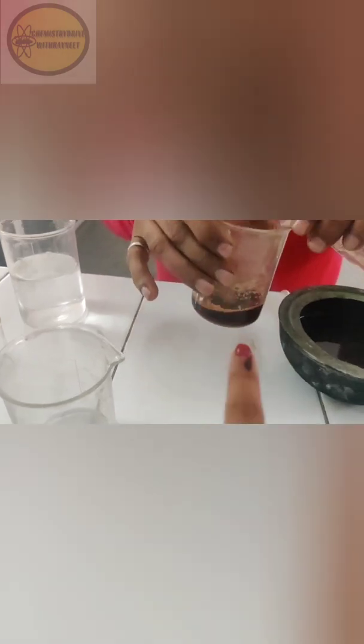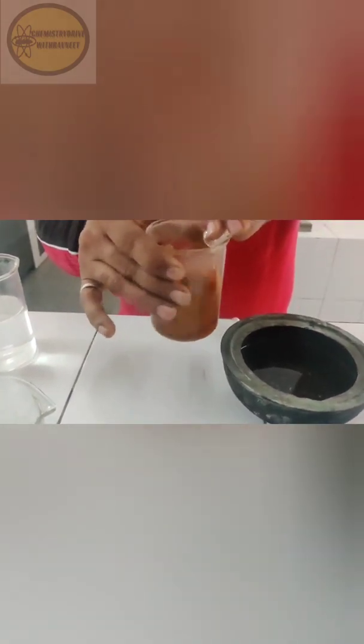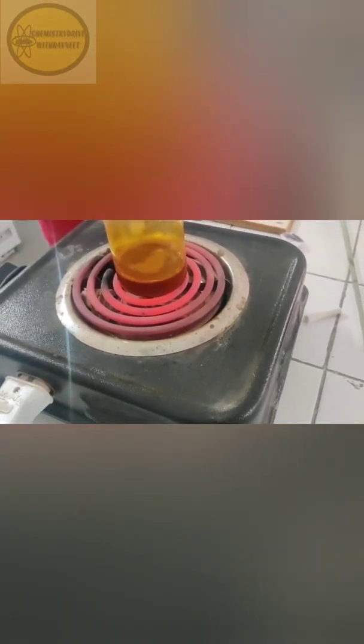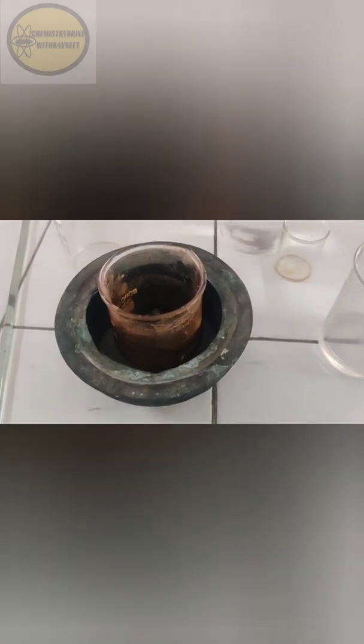The precipitates separate out. Now prepare about 20% NaOH solution. Take 7.5 ml of NaOH solution and add it to the reaction mixture in which diazotization and coupling have been done. As soon as you add the NaOH solution with constant shaking, the orange color is formed. Then warm this mixture to about 60°C and add about 2.5 g of NaCl to it. Shake it properly and cool the mixture on an ice bath.